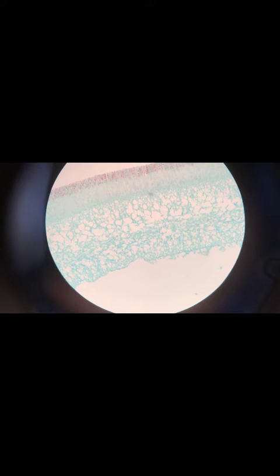Now, look what happened here. I zoomed in from 4x to 10x and my sample disappeared. What do you think happened? Well, when I zoom back out, I noticed that my sample was too high. Always center your sample before you zoom in.